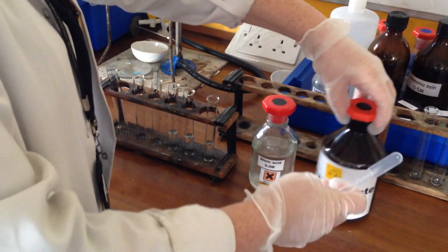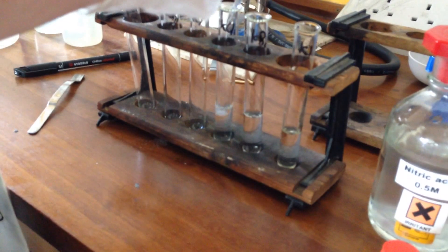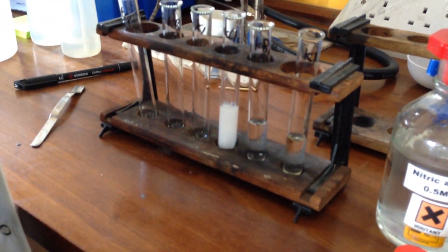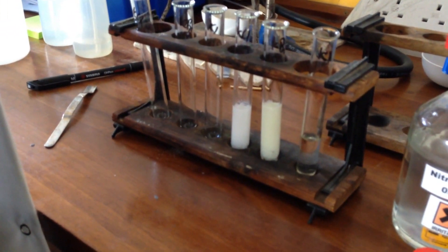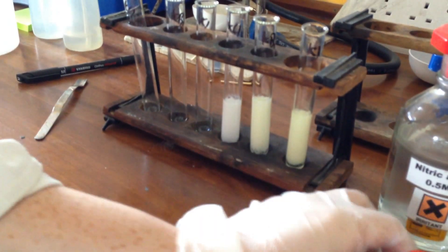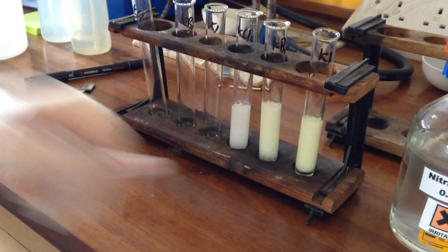And then in the silver nitrate. So here we can start to see the colour changes. Now these are all quite similar colour changes, but it's very important to remember the differences between them. So here we have white, cream and yellow.